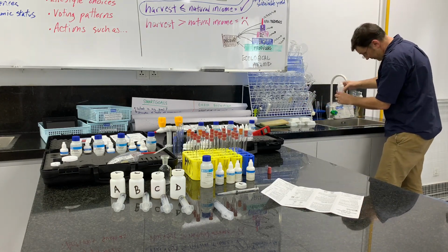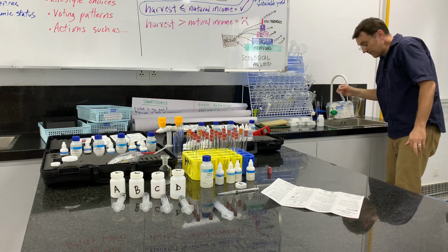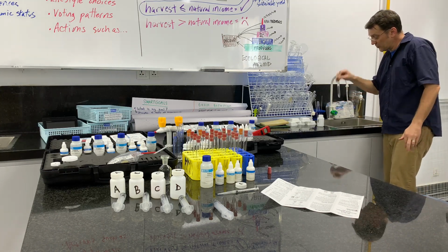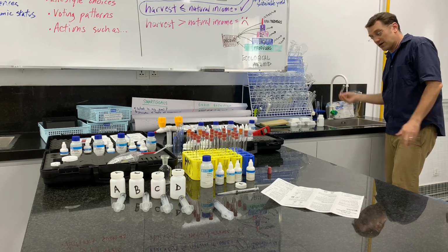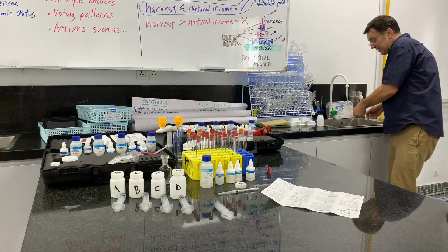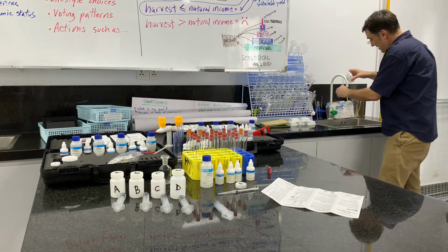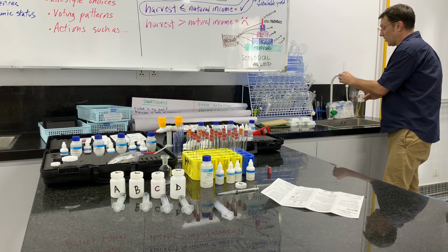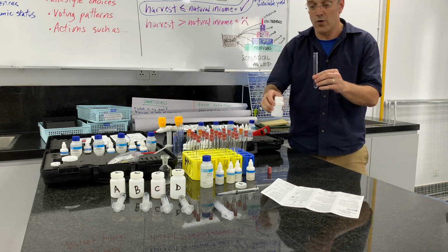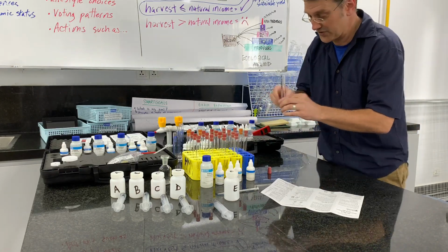I'm going to add enough of my sample that when I invert it a few times, I'm making sure that the entire interior surface area of the test tube has interacted with my sample. I've poured it out, and now I am pouring it until it overflows so that there's no air bubbles in my sample bottle. That's the first step.